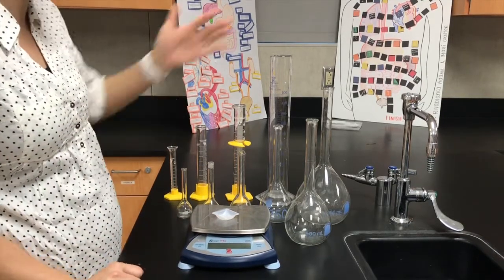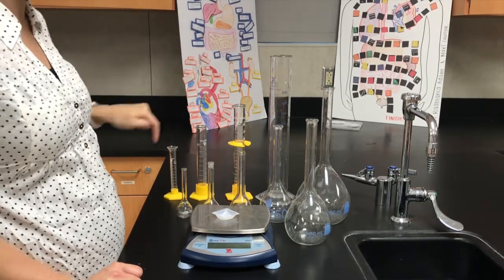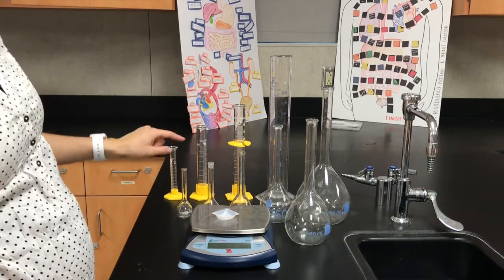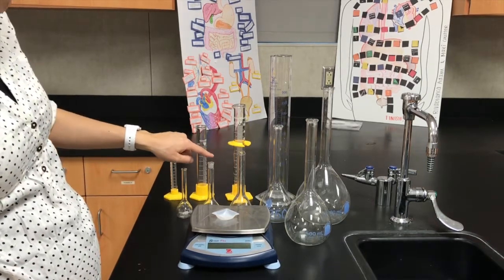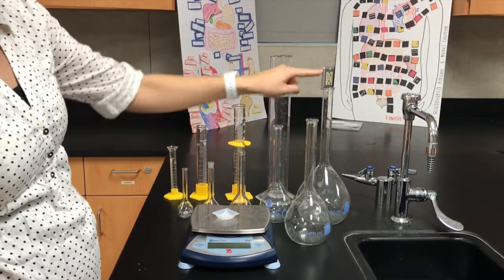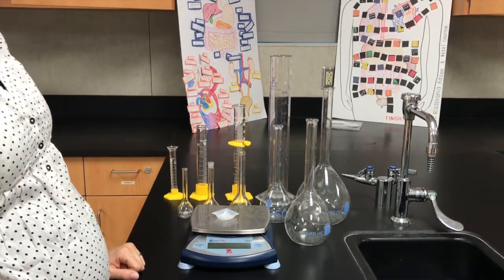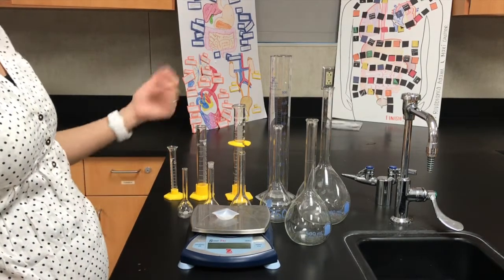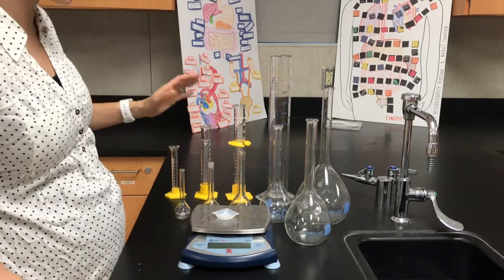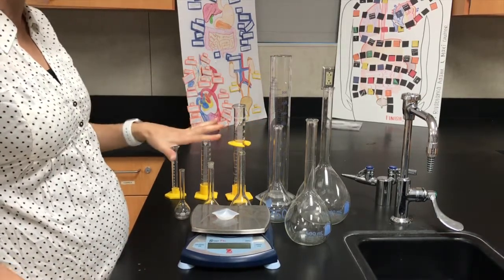Now that's not ideal because this has a really big top, and it's also not as accurate as one of these. So if you have the option of creating a solution with a volume of either 25, 50, 100, 250, 500, or 1,000, that's what we're going to do because we want to use a volumetric flask. But if you don't have that option, that's fine. Let's say, for example, I want a 30 mil solution. For some reason, I don't want 25. I can't use one of these because they don't have that volume.